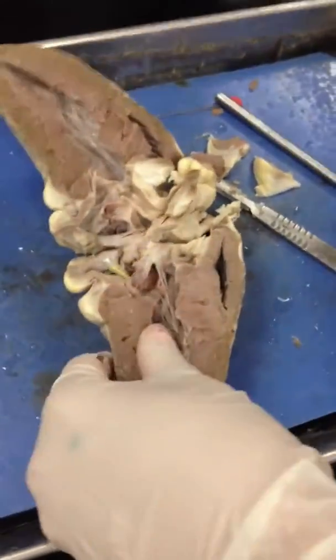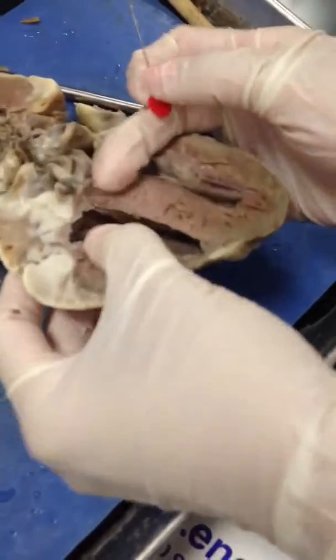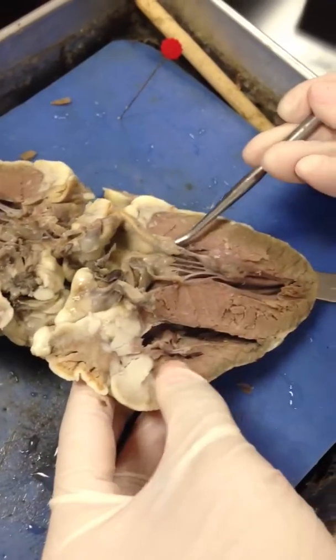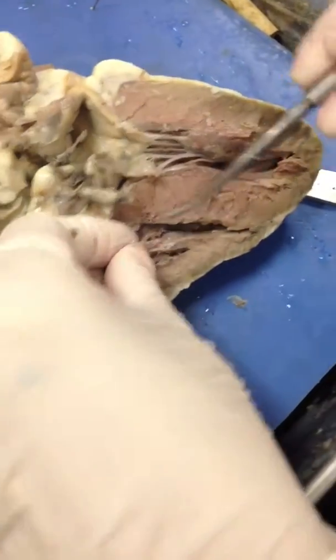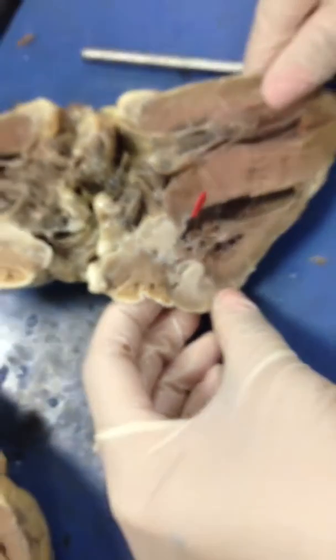The only other way that you would be able to tell is if you find the chordae tendineae. What she was trying to find is really prevalent here. So — bicuspid, tricuspid. Remember we saw this one — what was that valve? Bicuspid, because it's on the left side of the heart. Now this is on the right side of the heart. So we can see the chordae tendineae attached to the papillary muscles, and you can actually see the flaps of the tricuspid valve. So I could ask you what valve is that? Tricuspid valve. Good.